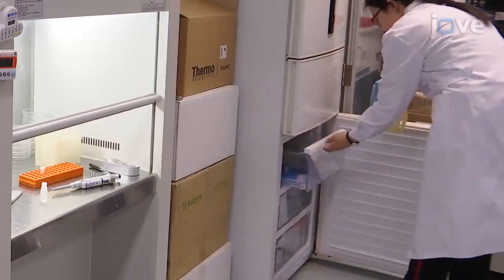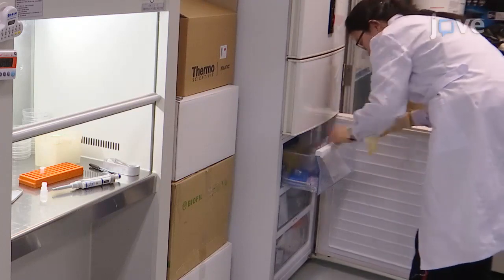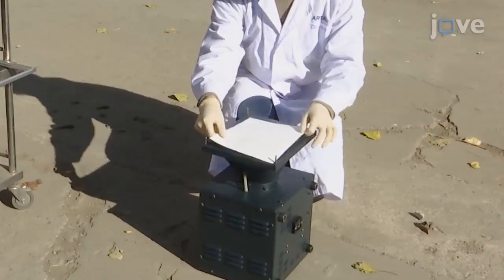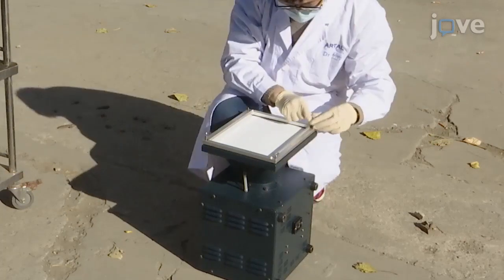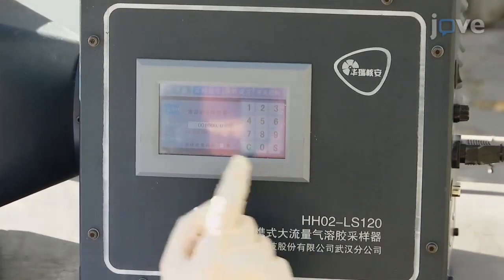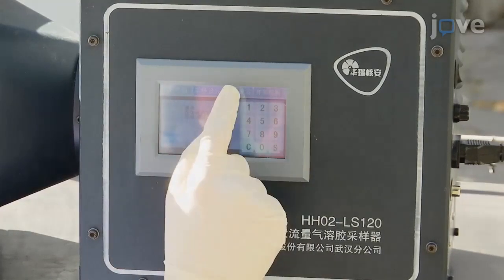At the end of the collection period, store all of the samples at -20 degrees Celsius, protected from light, until their analysis. For particulate matter collection by filters, equip a high-volume air sampler with 20.32 × 25.4 square centimeter filters, and set the sample to a flow rate of 1,000 liters per minute for the appropriate collection period.